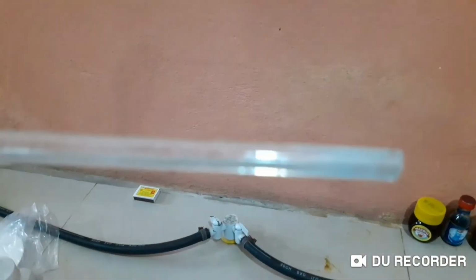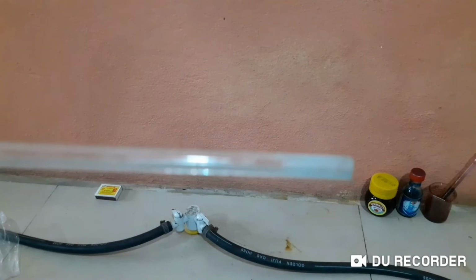But we'll take it out. I'll show you that later. There are very tiny crystals here. So I have to take this out. Here you can see, right? This part. I will use a tool and show the children. You can see some crystals formed around this glass rod. It's blue in color. So what we do is we have to take this out.